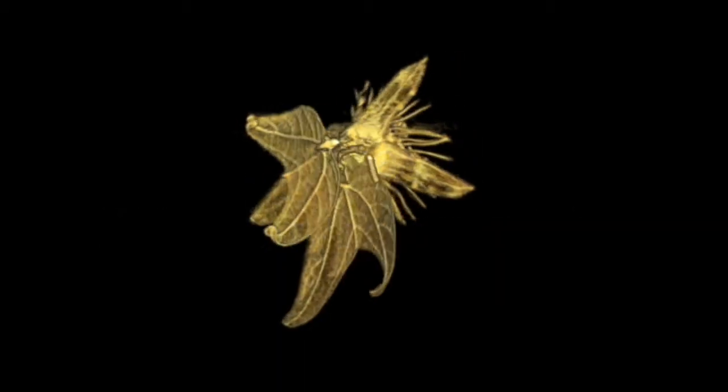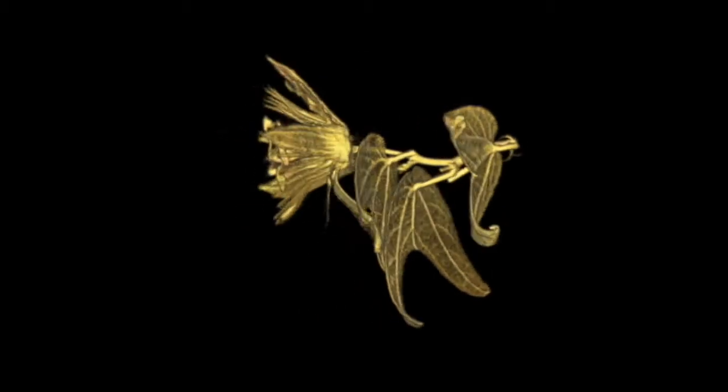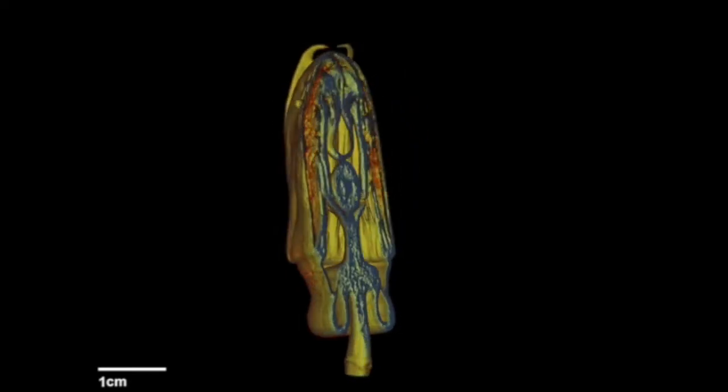X-ray microtomography, or microcomputed X-ray tomography, is a technique used to obtain 3D images containing both external and internal information of an object.